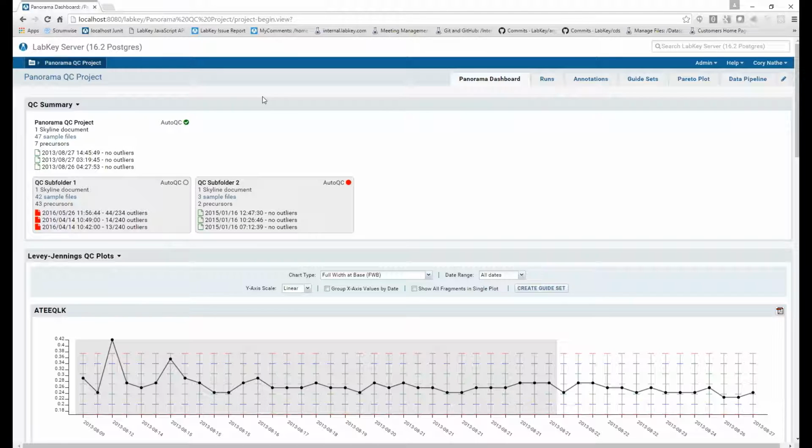With this change, we also will now show information about any direct subfolders of this container which are also of type QC. So you'll see those shown here in the gray shaded boxes. In this case, out of the 3 subfolders that I have in this project, 2 of them are of type QC, so we see information about those 2 here in the summary display.